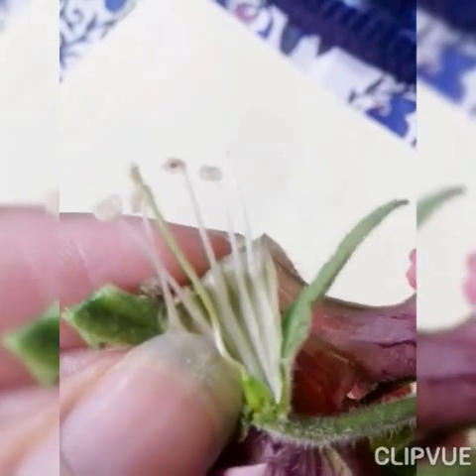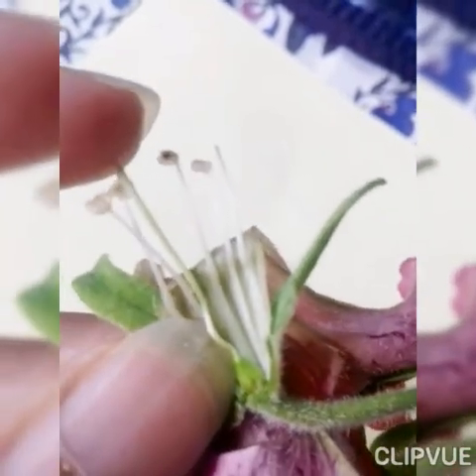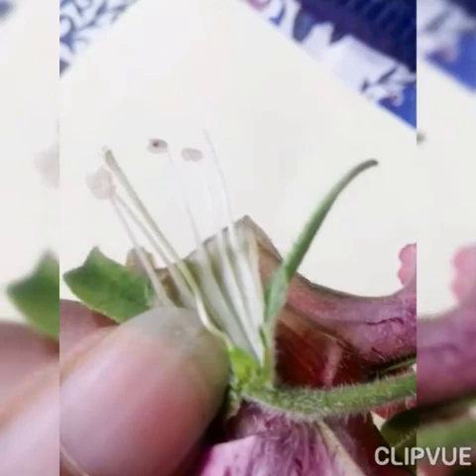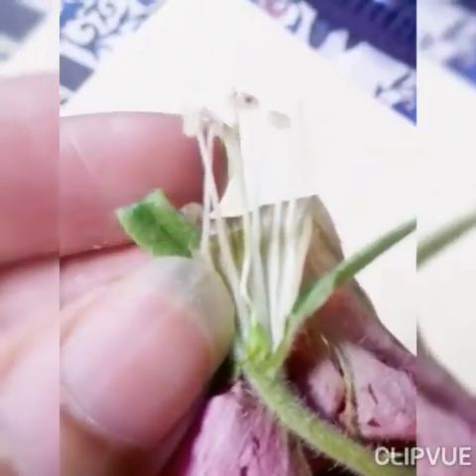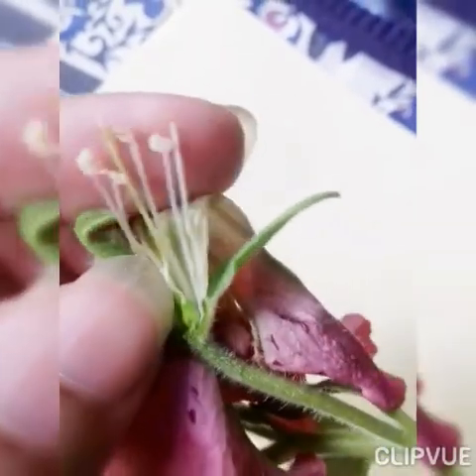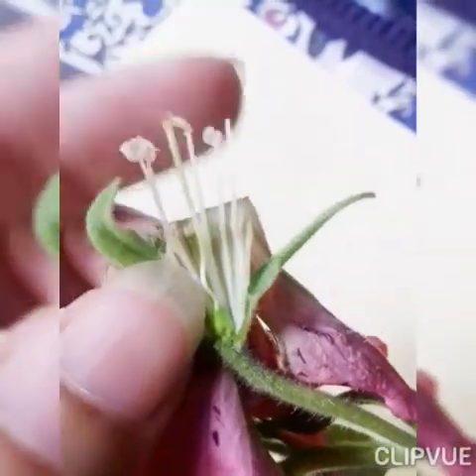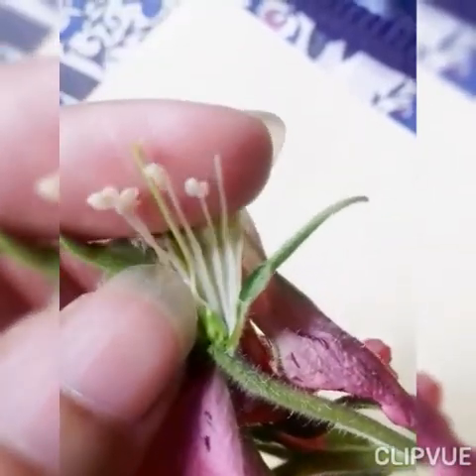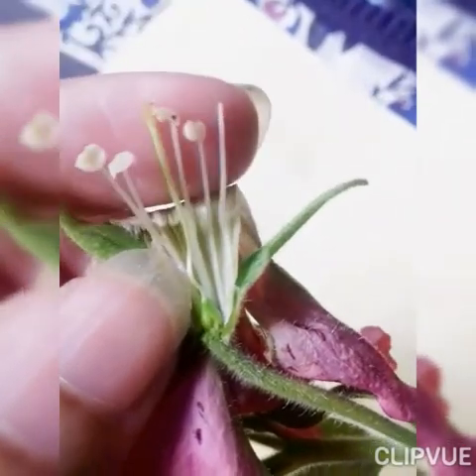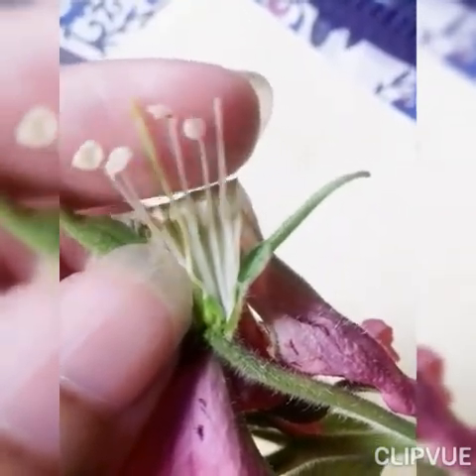On the stigma, the pollen grain lands, then by means of the style it goes into the ovary and fertilizes the ovule — that's how fertilization occurs. You can also see here the epipetalous condition where the stamens are attached with the petals.